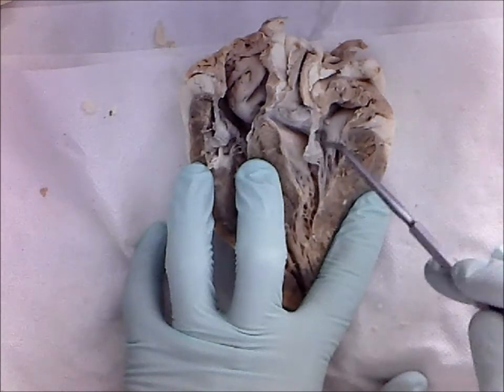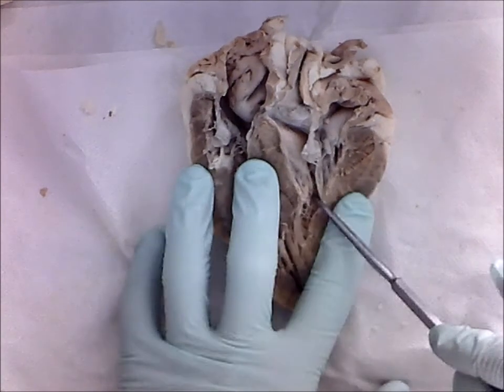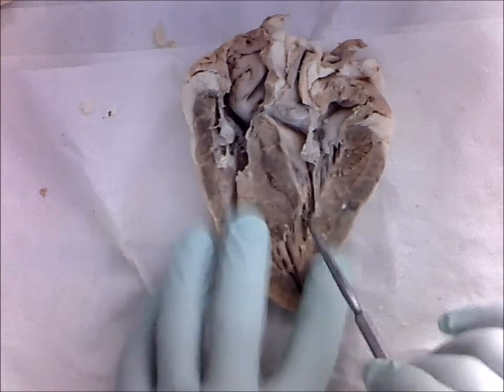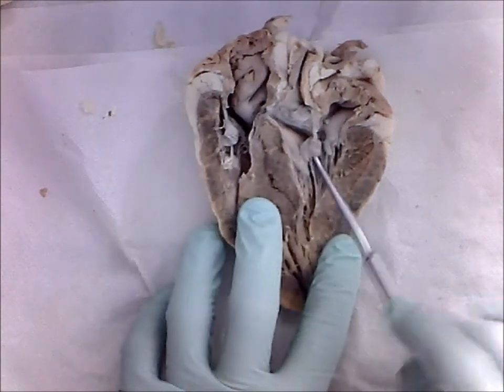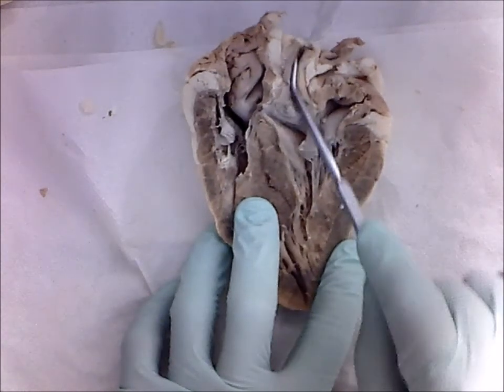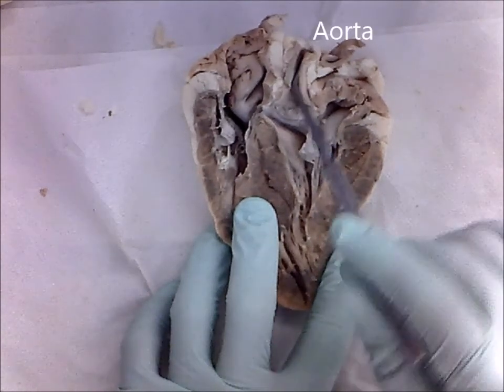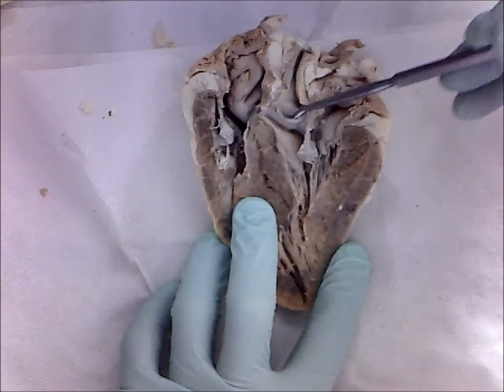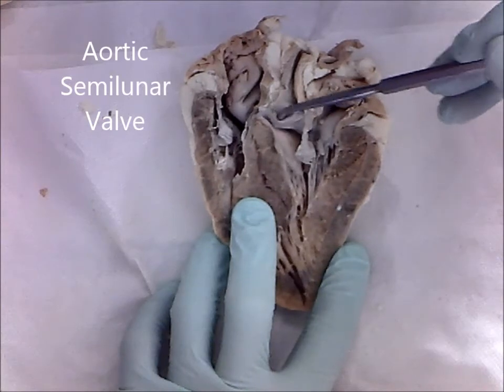From the bicuspid valve, blood then is passed through the left ventricle. And then from the left ventricle, blood is pumped to the body through this guy right here. This is the aorta. And on the aorta, you have another valve. This valve right here is called the aortic semilunar valve.